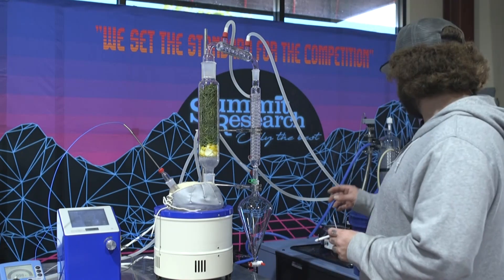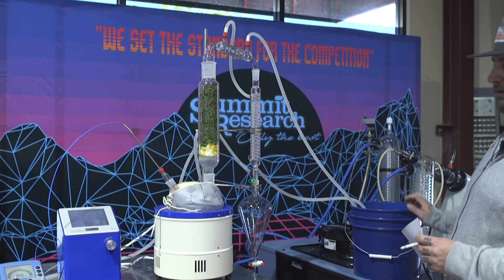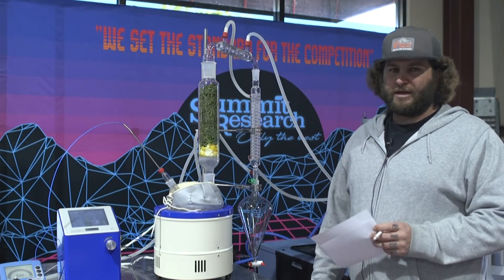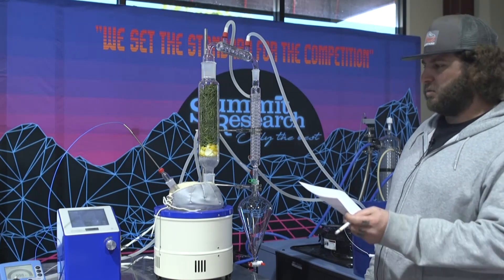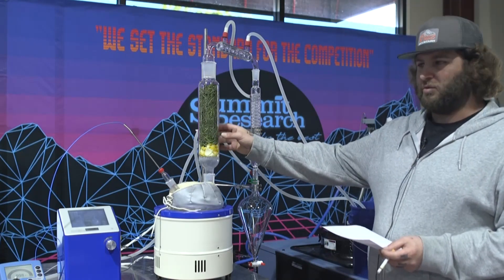In this scenario we're running just ice water right now because it was cheaper than hooking up an actual chiller and running glycol through it. For pumps, I recommend anything with a controller — a 2C pump or a 4C pump with a vapor pressure controller or SVC-1 will work really well, and a standard 80/20 will work too.